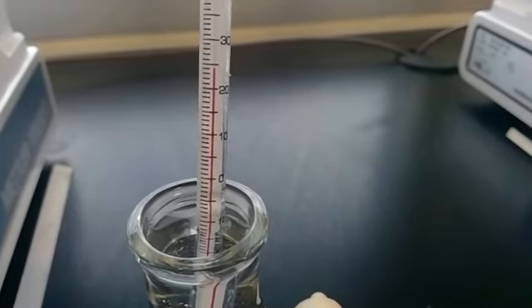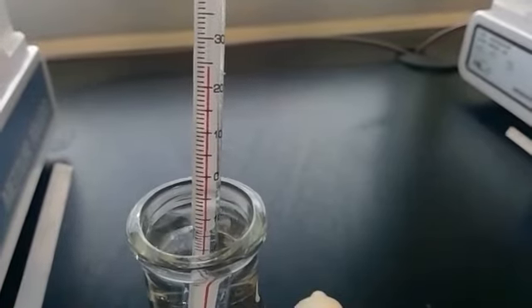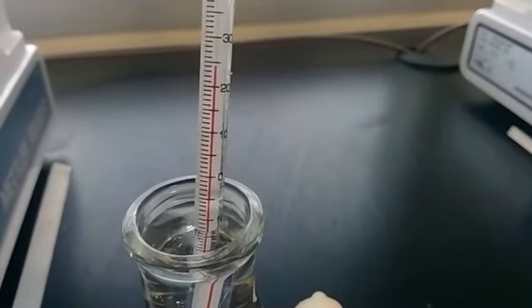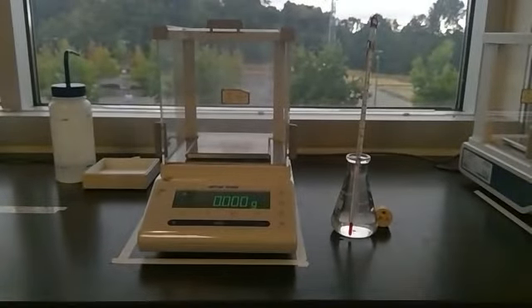So it looks like it's at about 24 degrees Celsius. We're going to estimate one digit past that. And so if you decide that's 24.0 or 23.9 or 24.1 or 24.2, make that call based on what you're seeing here. All right, now with this information, you should be able to use the density of water table based on temperature in your lab manual to determine the volume of space inside this flask that the gas will be able to occupy.